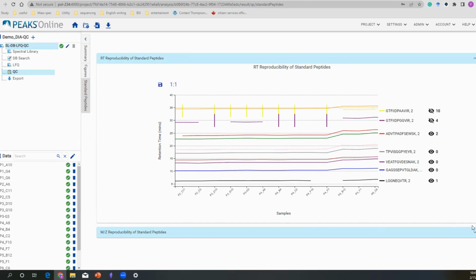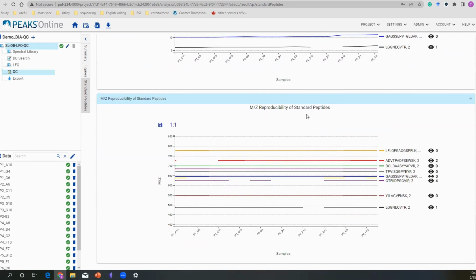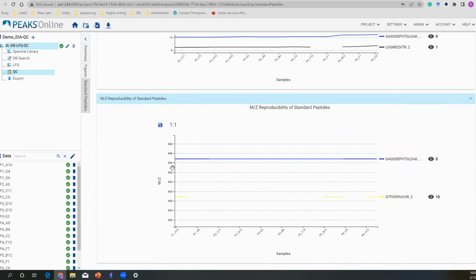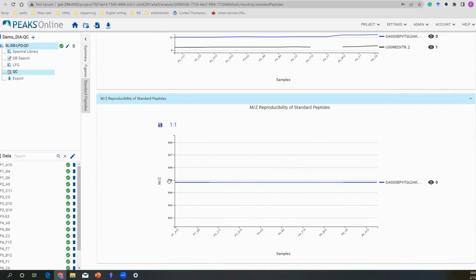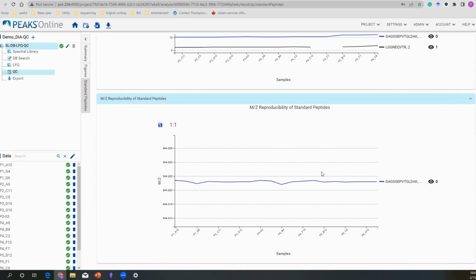For the mass-to-charge ratio, here is the mass-to-charge ratio reproducibility of the standard peptides. You can see how my mass spec behaves. With similar logic, we have the unseen numbers plotted in here, and you can still zoom in to focus on one peptide. We are seeing, okay, there's some fluctuation in my peptides, but in general it's still quite good. It's only, let's say, plus minus 0.003, something like that.